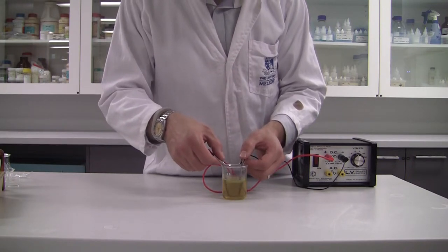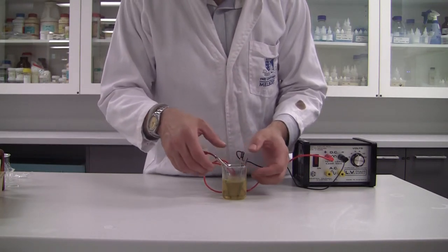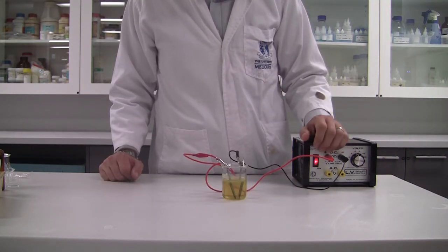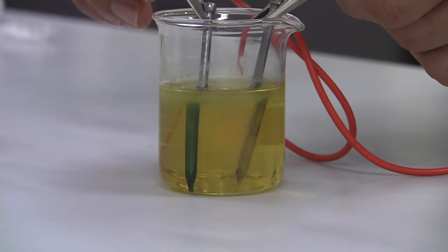At the start, the first few seconds it doesn't look like much is happening, but very quickly you'll start to see a bit of pinkness around one of the nails and a blue substance around the other. The longer you leave this, the more that will build up.